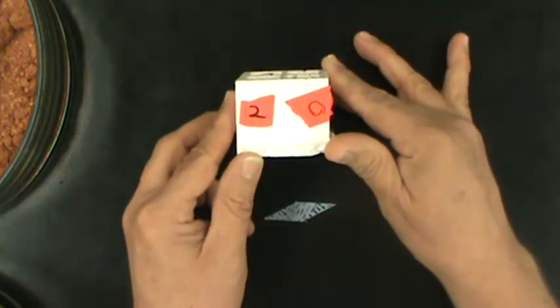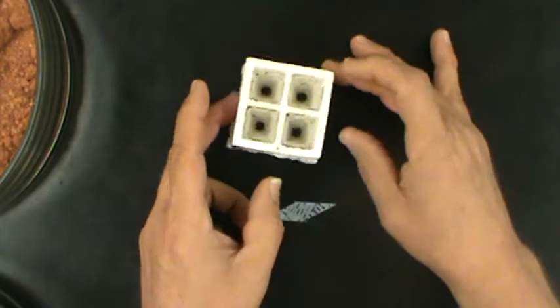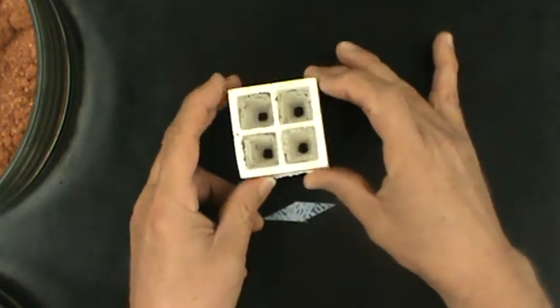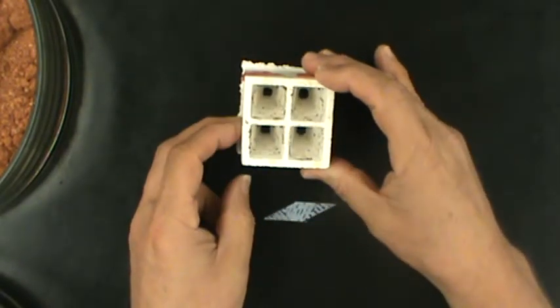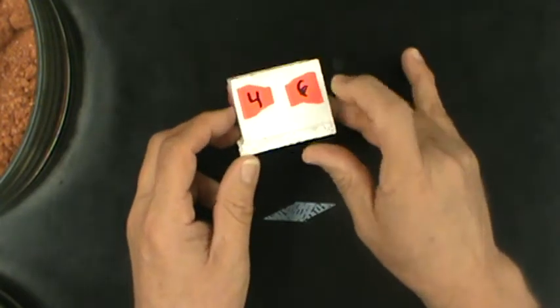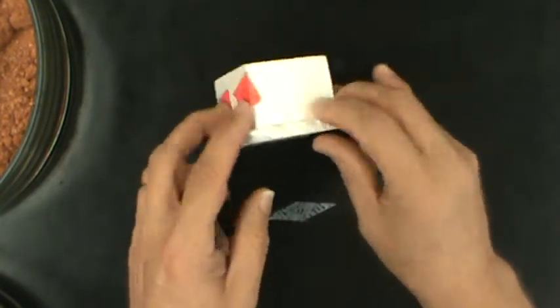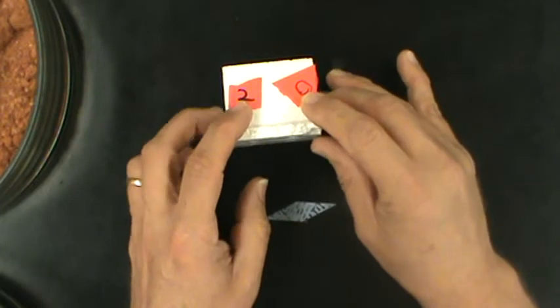This system uses these small styrofoam squares called quads that have one, two, three, four places for you to plant your seeds. You will need to make sure you label your quads so that you can identify your different treatments.